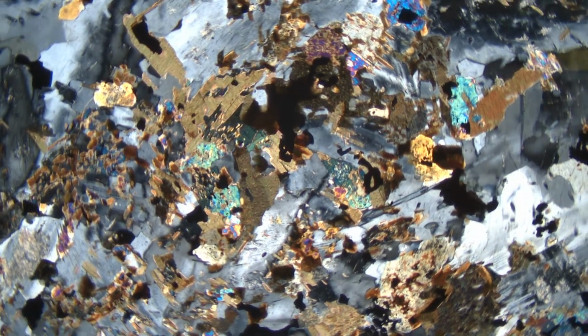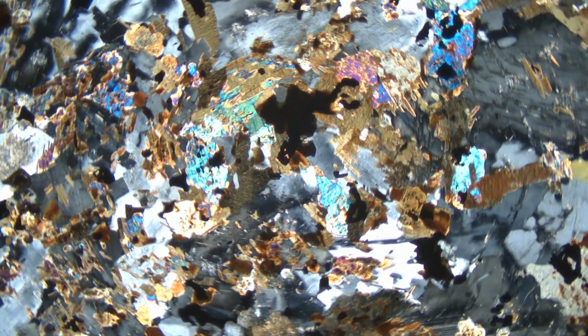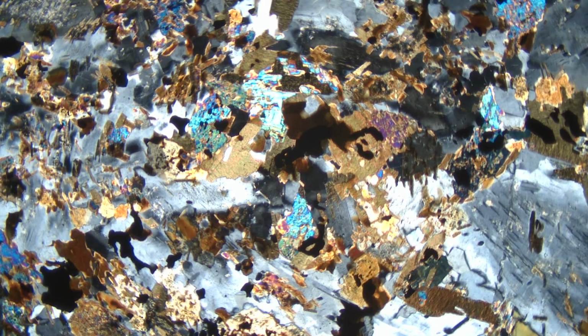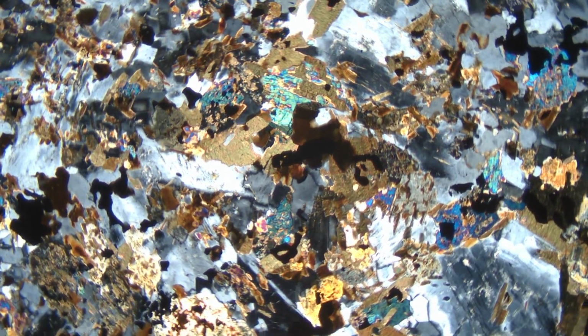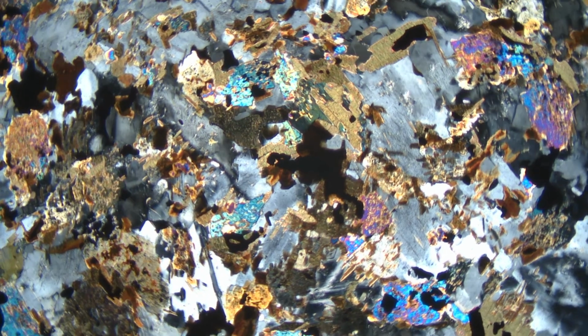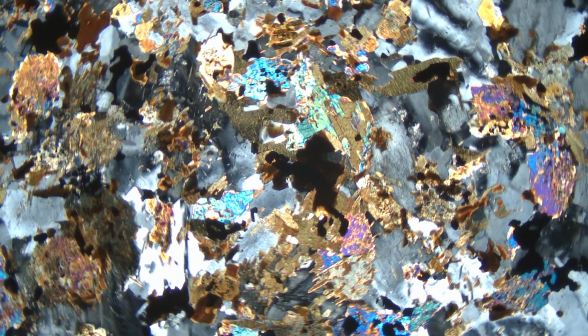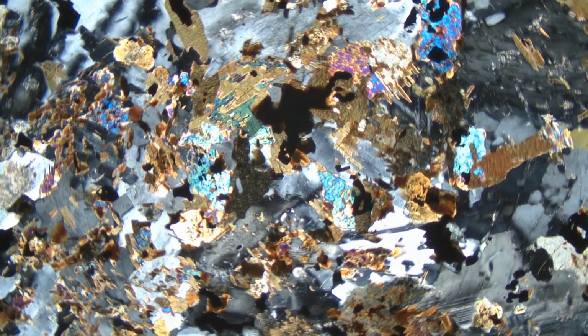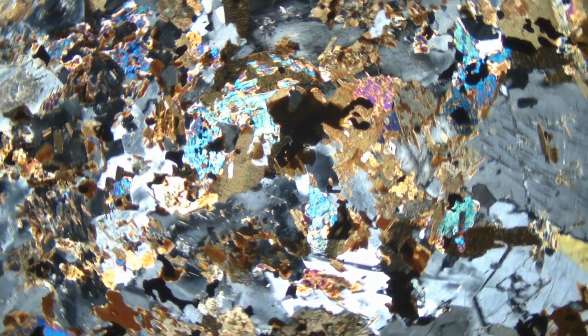We have only looked at two of the standard ways that an optical microscope can be used. For making some advanced measurements, or in cases where other things are ambiguous, there are a number of other lenses and filters that we can insert as needed, and we will get a number of different views, which also will provide us with very valuable information.